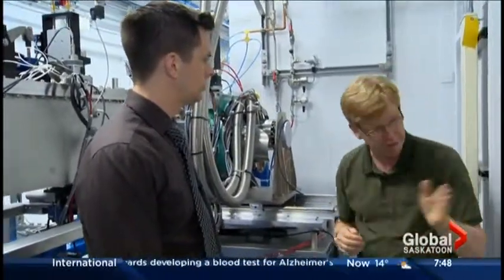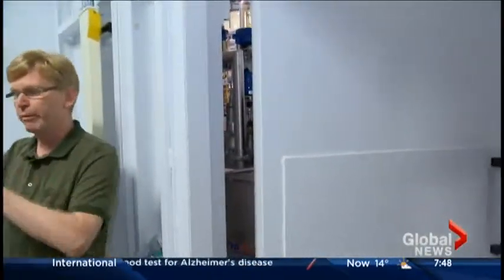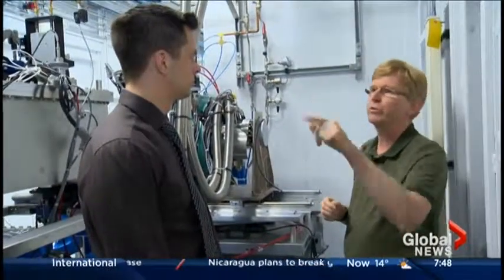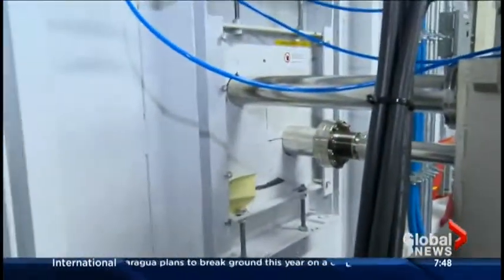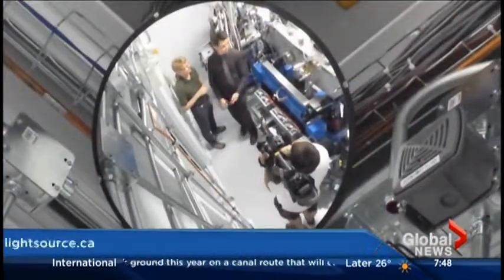This is the part of the beamline that you normally wouldn't see — the door would be closed when it would be operating. Everyone would be protected from the radiation coming through here. And eventually, the beam of light goes through, and that's where people would do the final experiments, beyond that wall. Well, I don't think I learned about this in grade 9 physics — thank you very much for showing it off for me today. Pleasure to have you here, Kevin. Thank you very much.